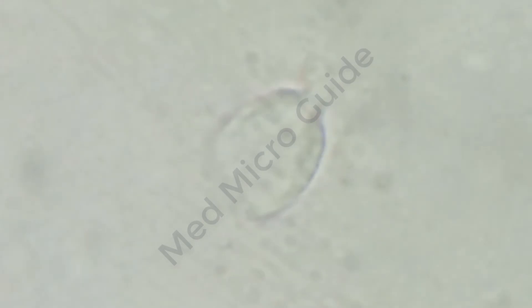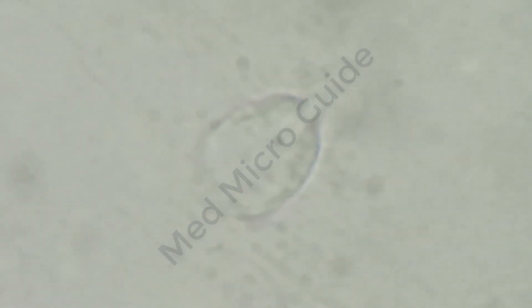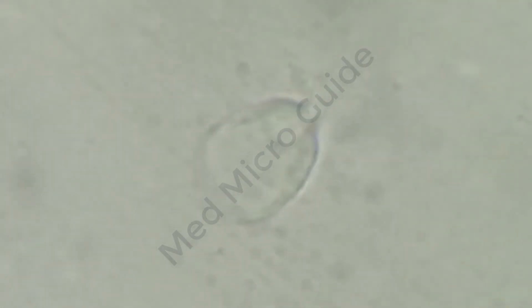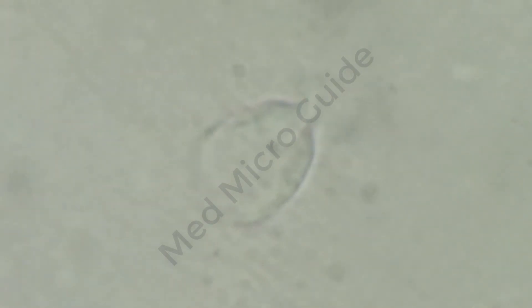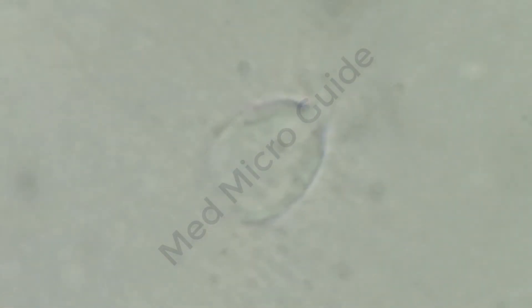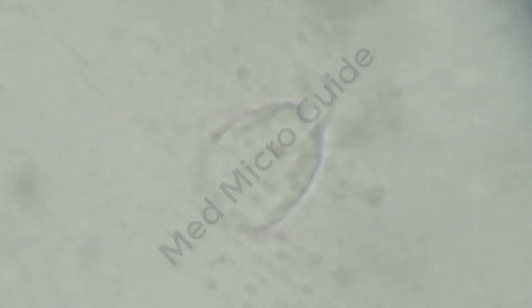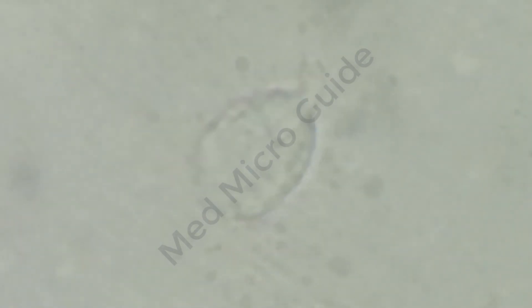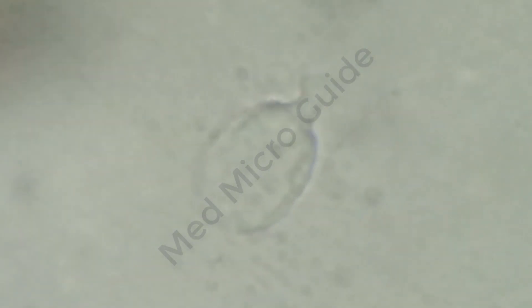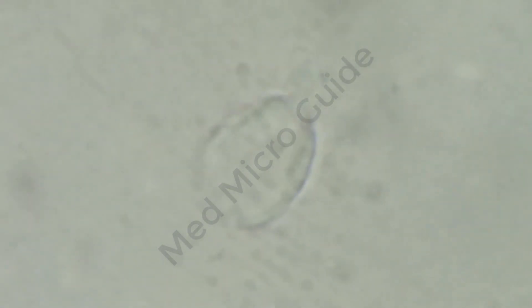So after a long time, when the motility has ceased, I have put oil on the cover slip and focused with the oil immersion objective. You can see a tiny flagella moving.